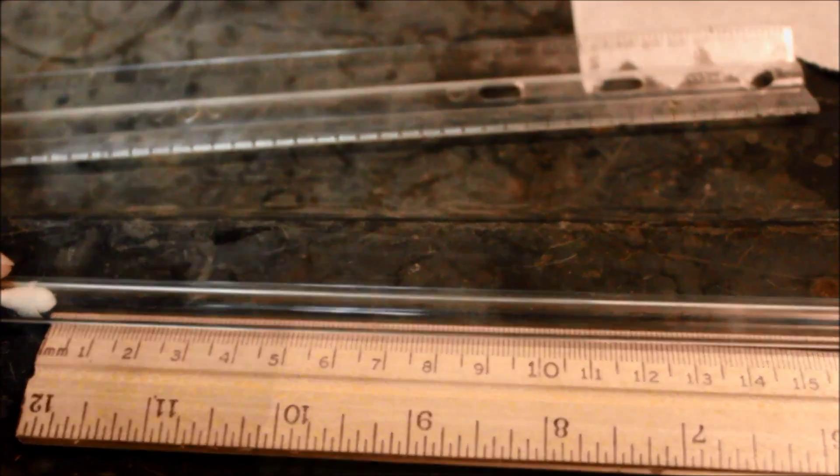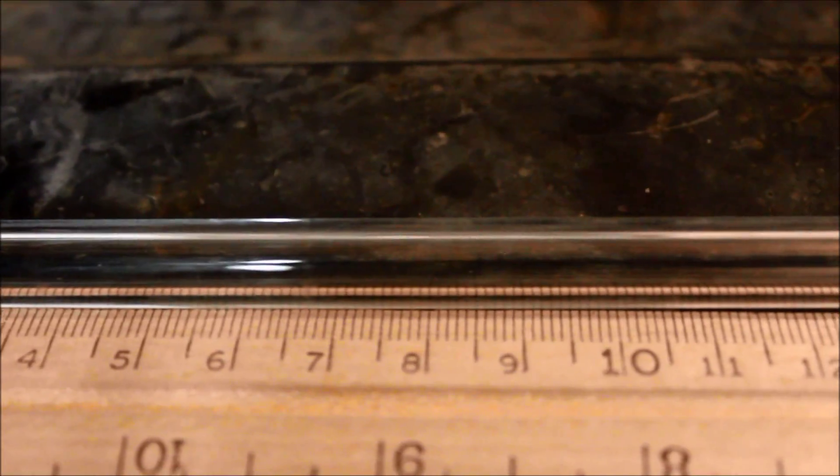We measure the distance from the q-tip to the ring for both ammonia and HCl.